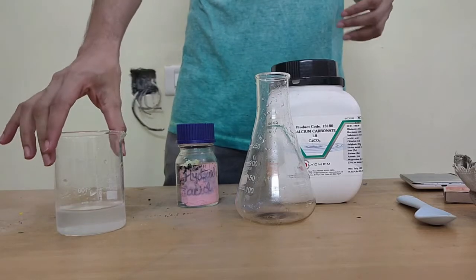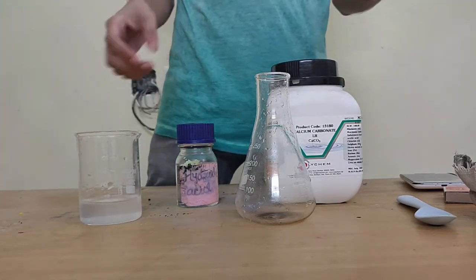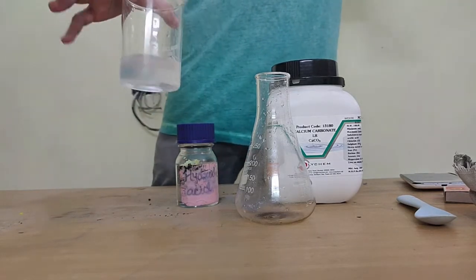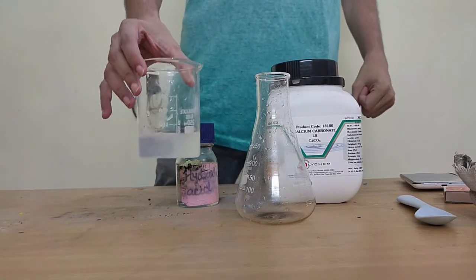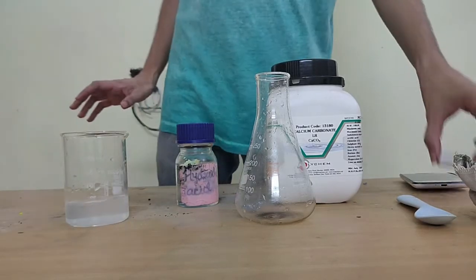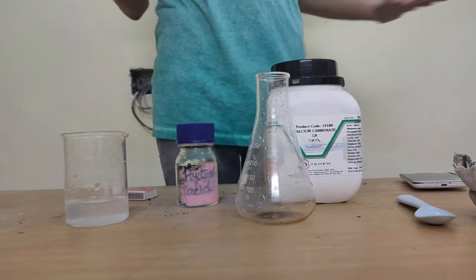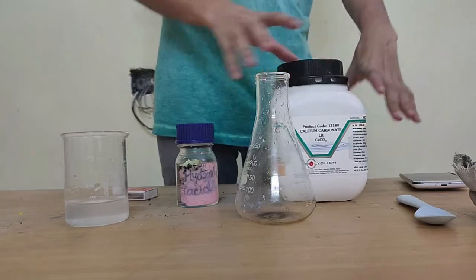There are two ways to test for this reaction. I'll tell them to you shortly. One of them is through lime water. It's not the actual lemon and water, not like that. Lime water is a chemical called calcium hydroxide. It's a solution. That is one way to do this test. Another way is with a matchstick, not a pop sound test, a different test. We'll look at it shortly. I'll explain them in a bit.